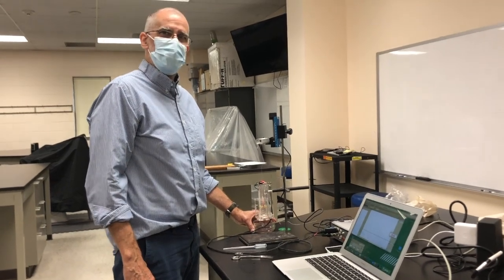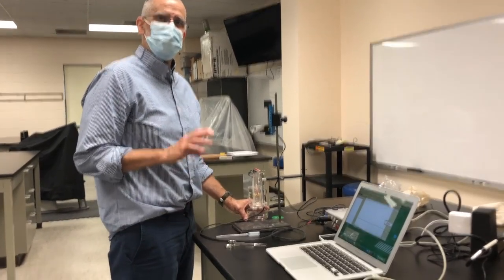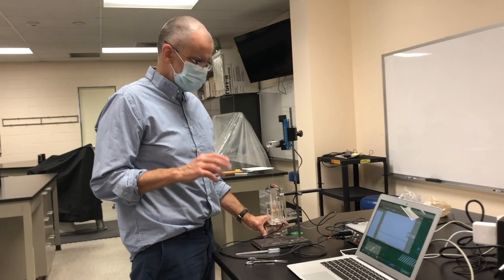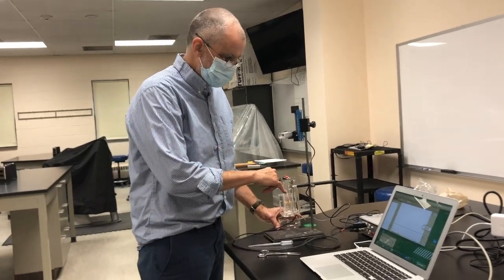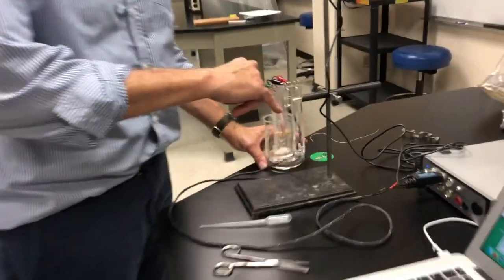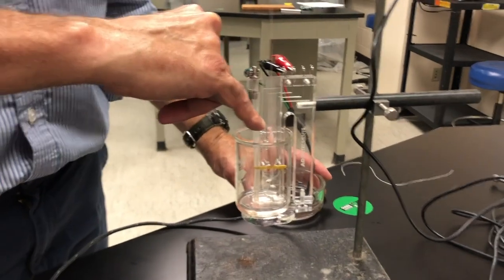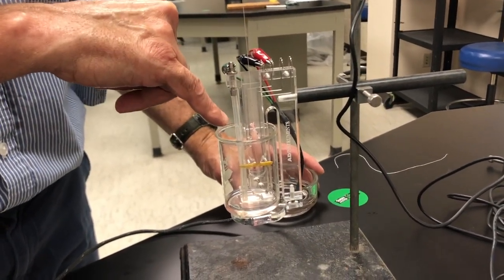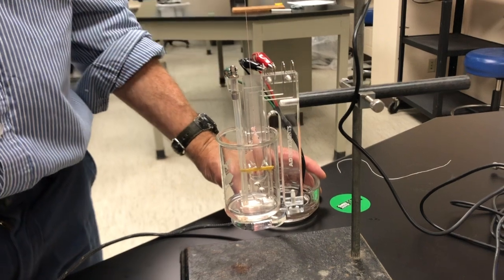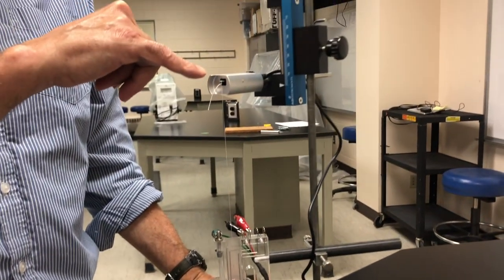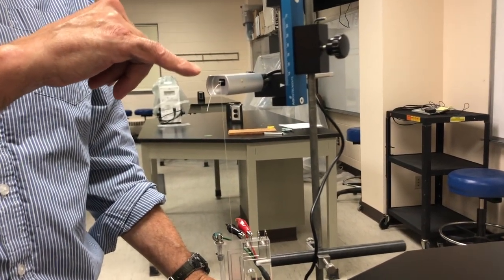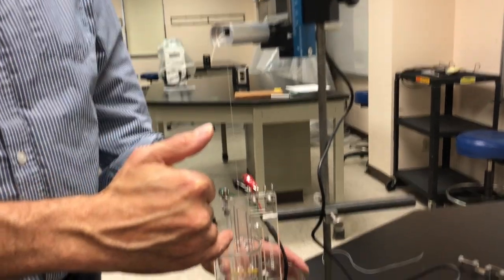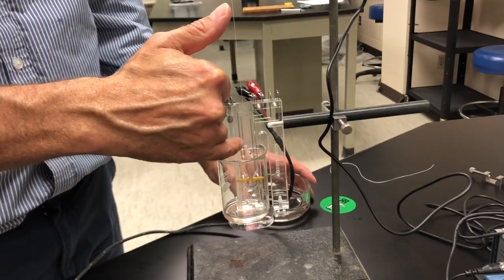Alright, so for this experiment, this is actually a muscle twitch experiment. It's a classic setup. You have a frog gastrocnemius muscle sitting on a stimulator and it's anchored at one end by a little rubber band there tethered to this force transducer and the force transducer is going to tell you how much force occurs when this muscle contracts.